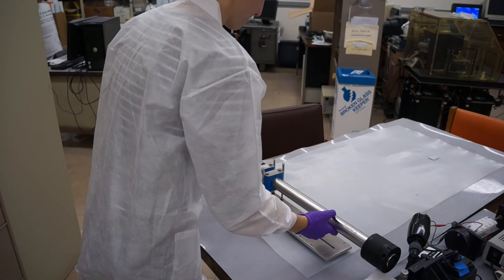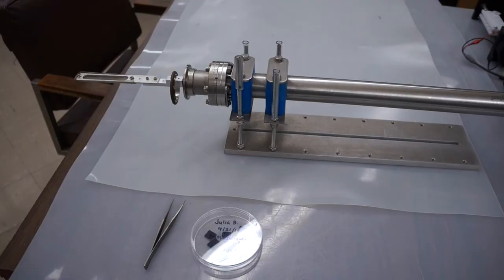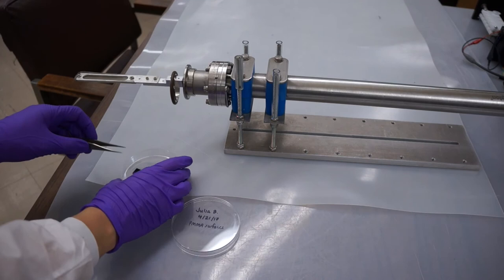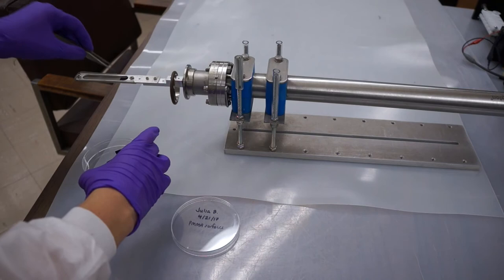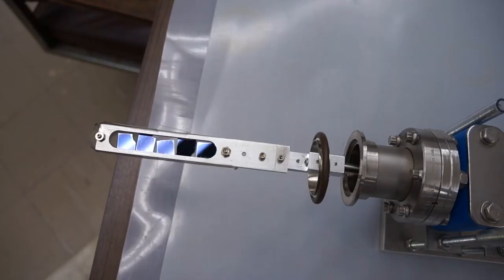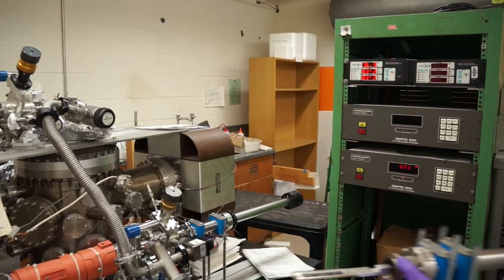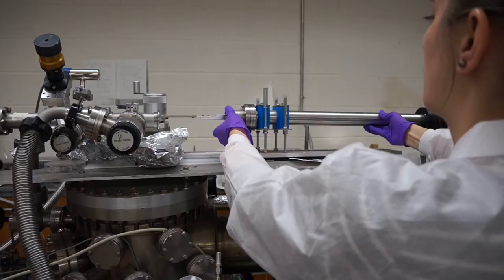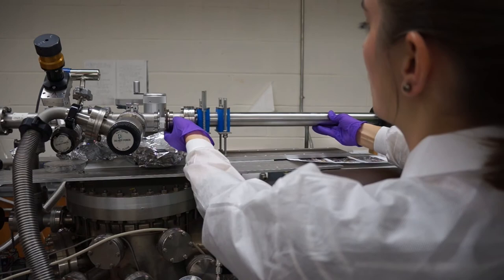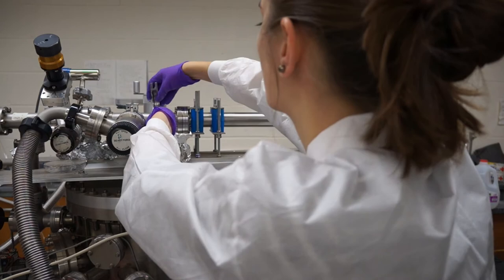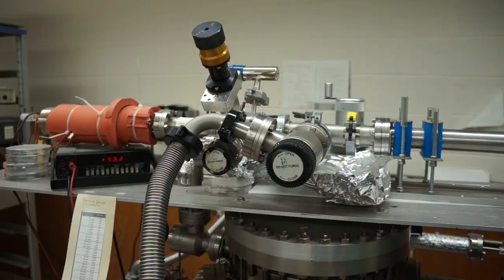Carefully place your PMMA surfaces into the sample holder, making sure none of them is overlapping another one of them, and that each is flat on the wire mesh part of the holder, and not on top of the metal skirt surrounding it. Then, while holding the rubber o-ring in place, transfer the sample holder back from the table into the sample line, and fasten it closed with the yellow flange clamp. The sample holder is a bit heavy, so make sure to be careful and deliberate despite its weight.